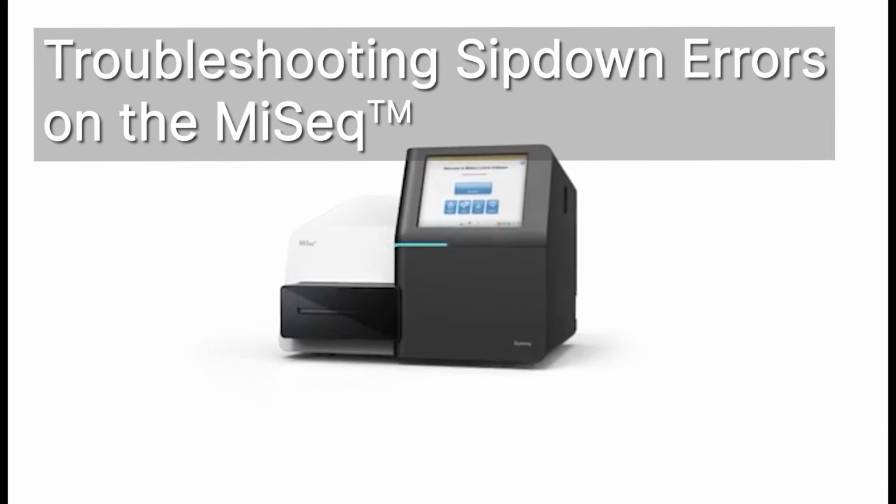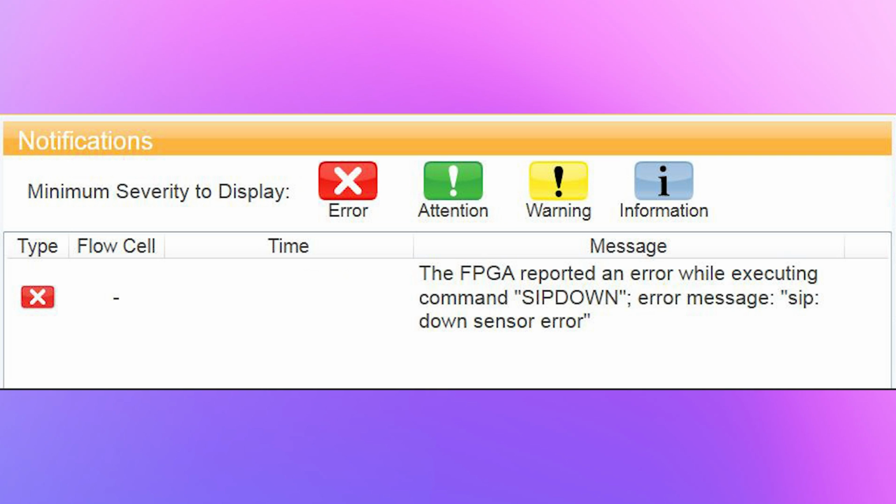Troubleshooting sip-down errors on MiSeq. Steps to resolve a sip-down error.